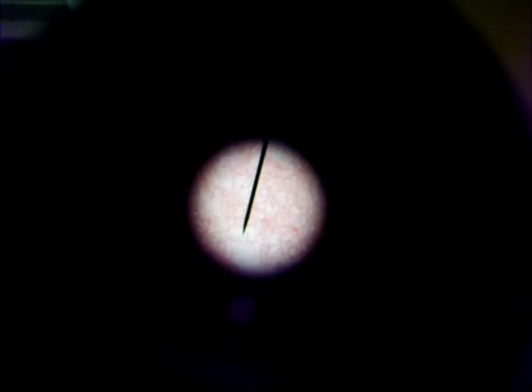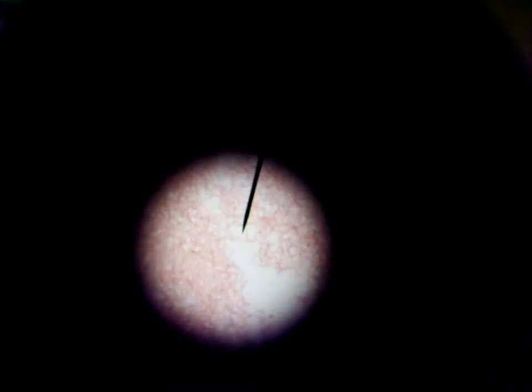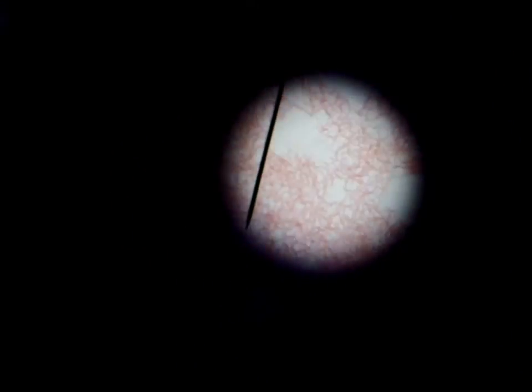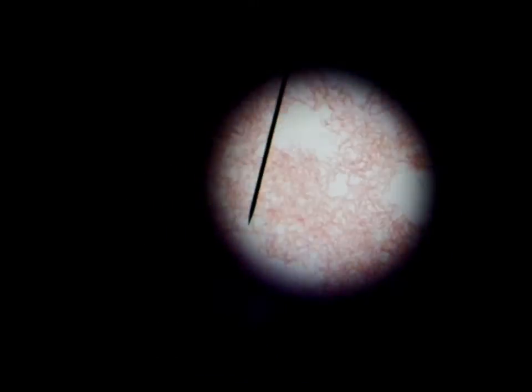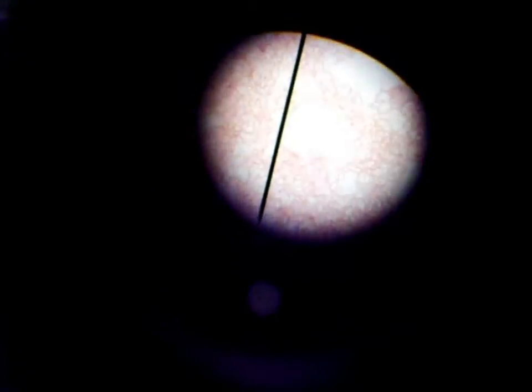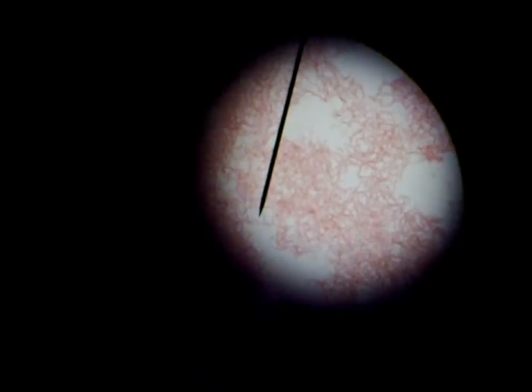The posters on the cabinets in the back are some good examples of shapes and all that kind of stuff. There are the bacillus rods and it's pink, so it is gram negative.